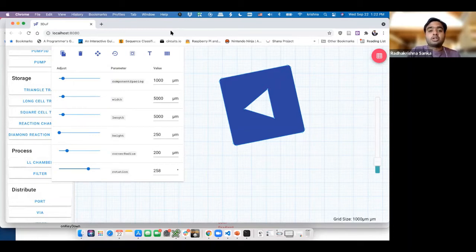Now, if you were doing this on your own new branch on your computer, you would make a pull request. And essentially what we ask you when you're making these pull requests is, tell us, why is this component necessary? For example, if I did a PR for this particular component, I'd say no, this is not useful in any real world application. There's no papers which have used this, and there's no point in having this. But let's say you're working on your own publication, do put in that we are working on a manuscript right now, and we believe this is good for these reasons, and then we will actually accept it.